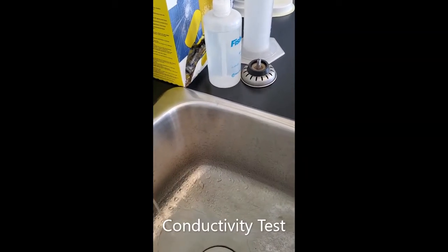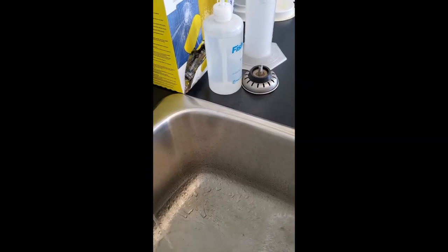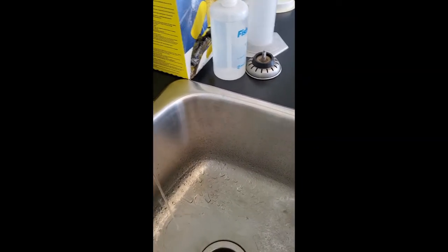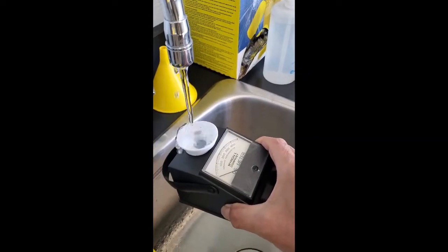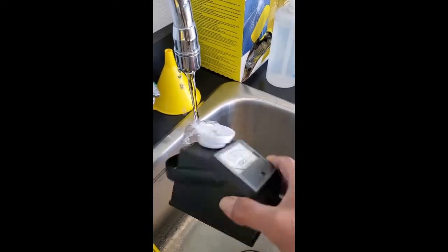This is the TDS test, the conductivity test. So what you want to do, you want to rinse it a few times first. I put it in there, rinse it once, twice, and three times.